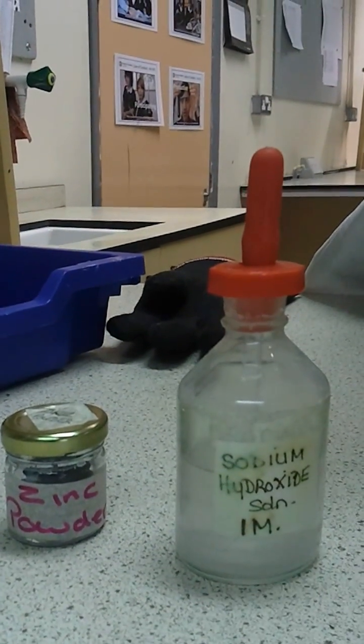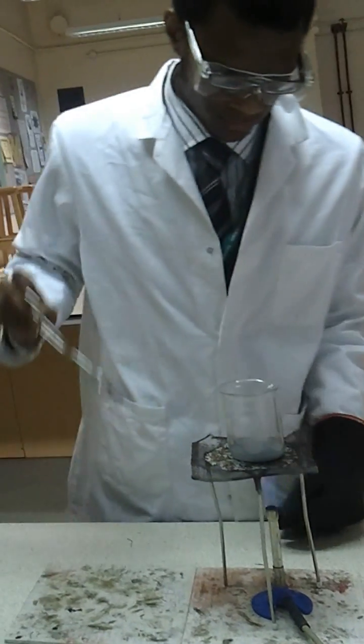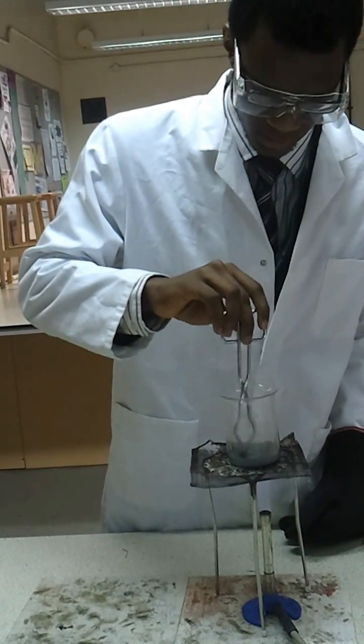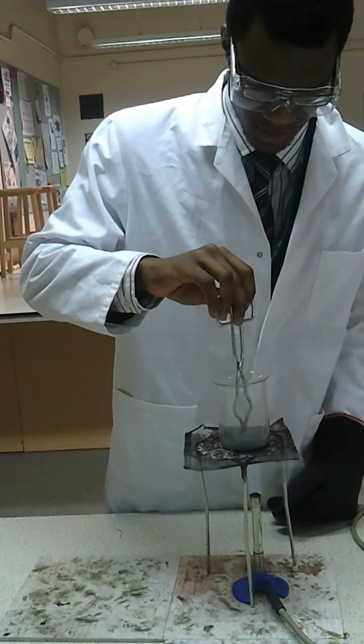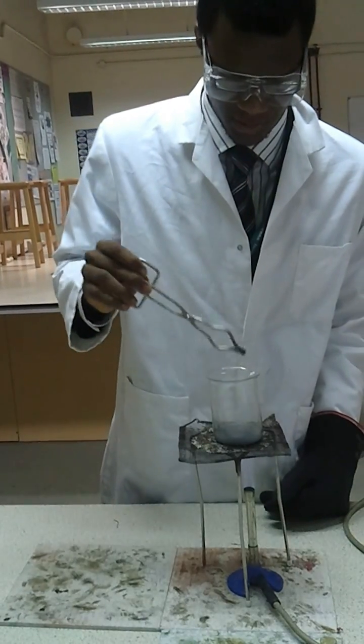I'm going to add this coin into the mixture. I've got tongs here and I just give it a nice stir. And right now, it's been coated in zinc.